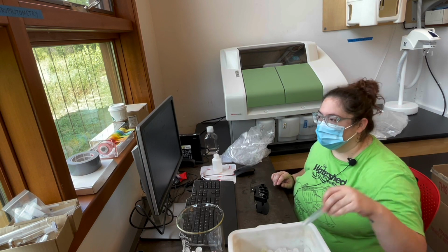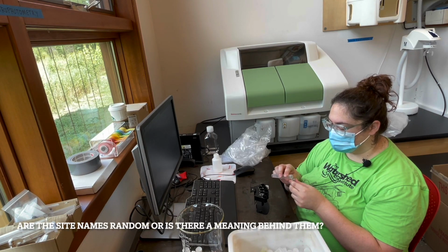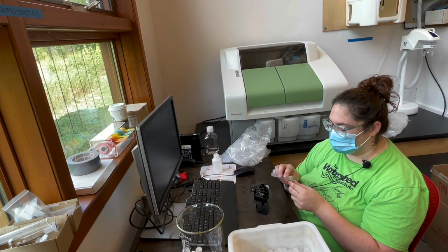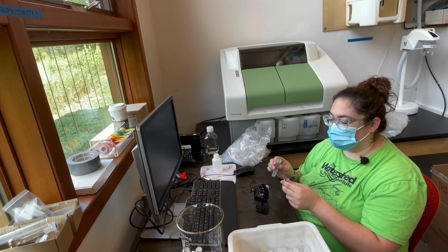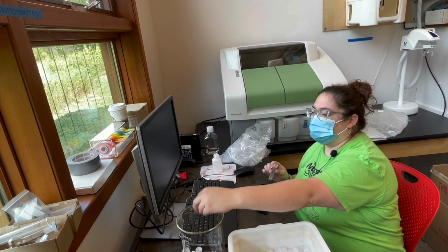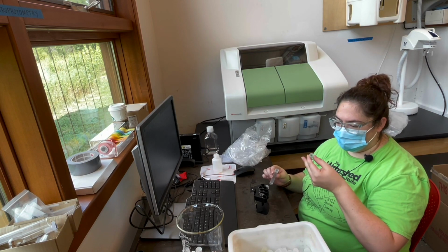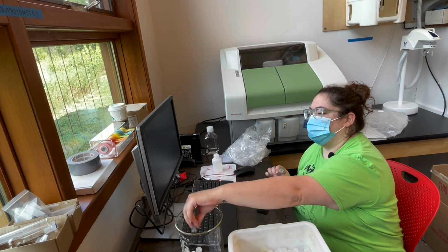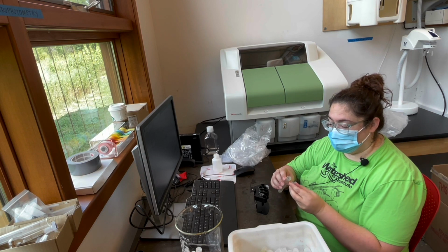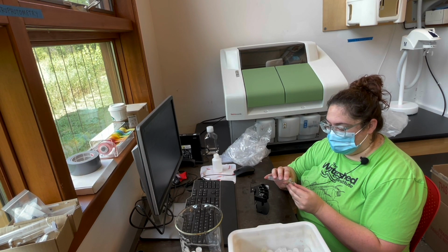Okay, so that's one. So each sample has a site name, right? That's correct. Are the names random? No. So this sample that I'm doing right now is GRPL1, and that stands for Grop Lake. And the one just means it's the first site on Grop Lake. So if we ever add another site, it would be GRPL2.